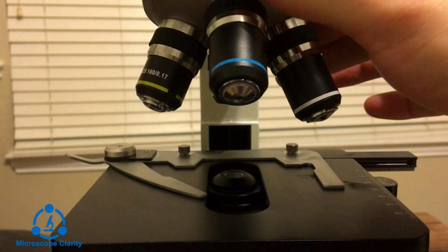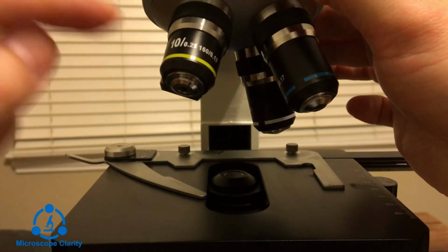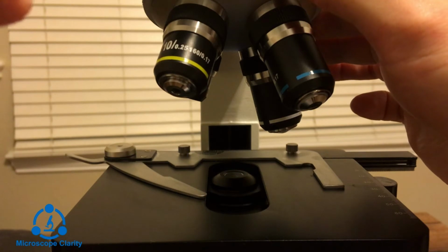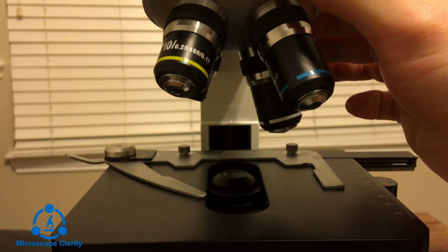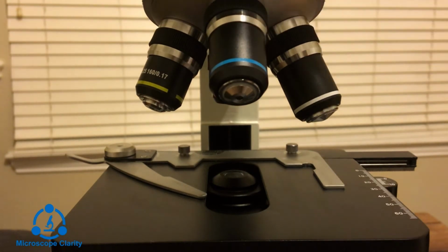Okay, so here's the microscope, and we can see here on the objective lens, this big number is going to be your magnification, and then the optimal numerical aperture for this objective is right after the slash there. So this is 0.25. And remember the calculation is we take the sine of theta, which is half of our angular aperture, and multiply that, in this case, by 1 because the refractive index of air is 1. So let's take a look at what we mean by theta in this case.